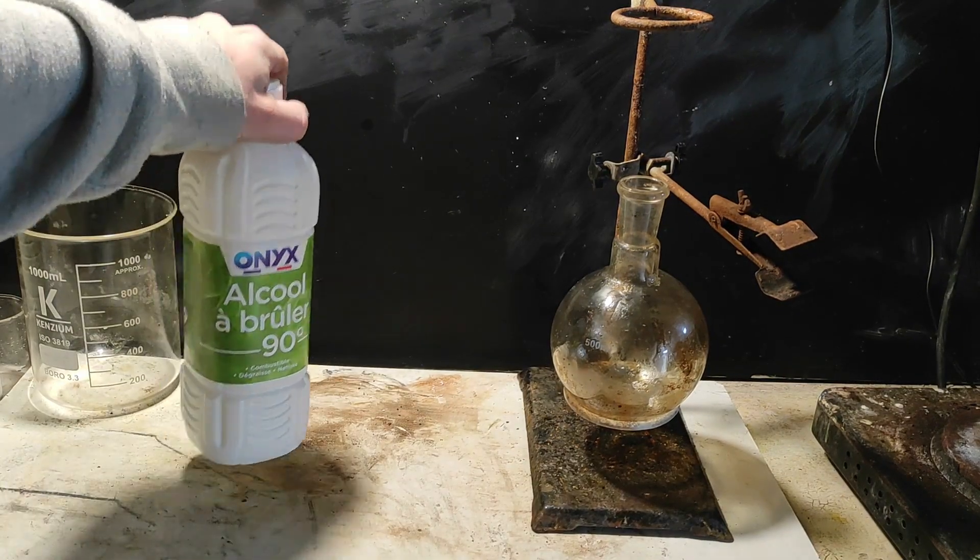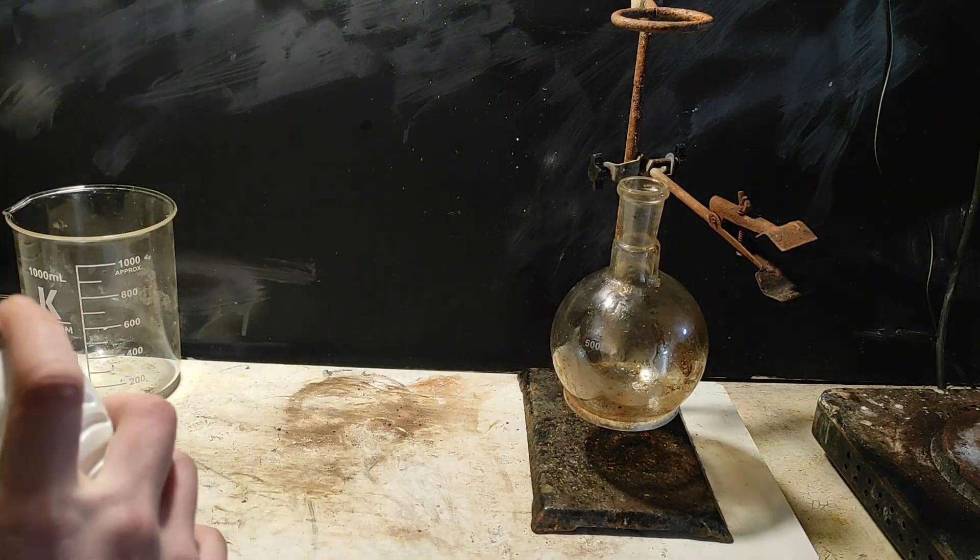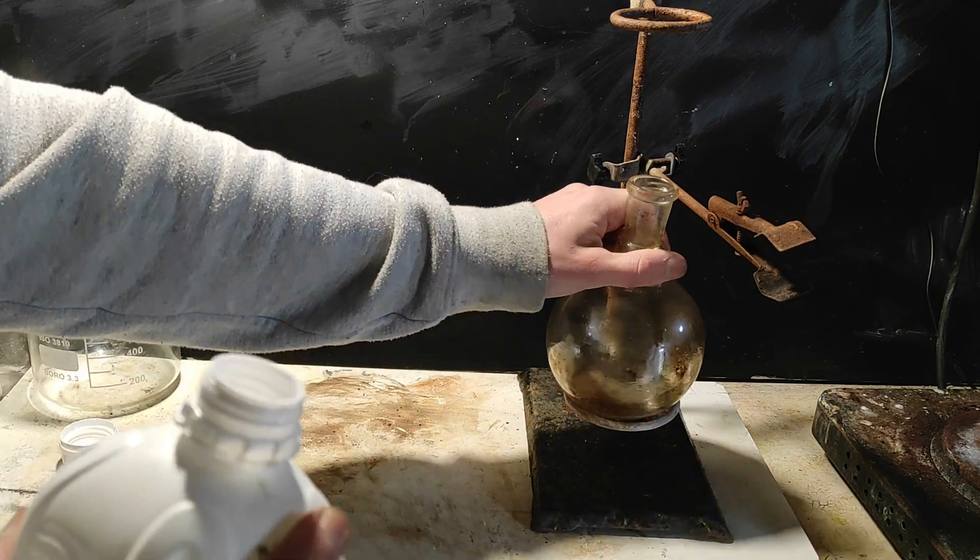So, my guess is that if we use some alcohol, it's probably going to dissolve, and we're going to be able to clean it this way. Otherwise, you know, you have piranha solution, but I don't want to waste my sulfuric.